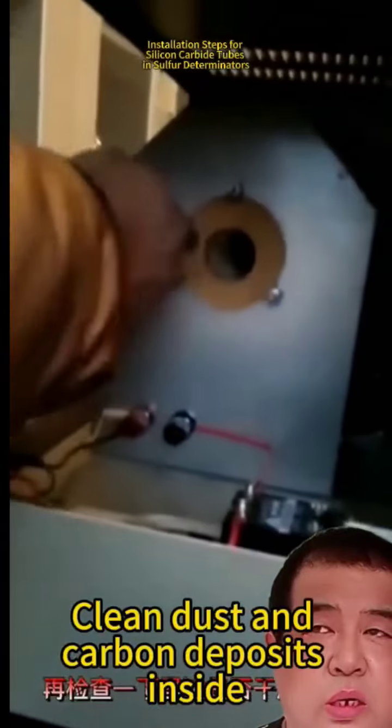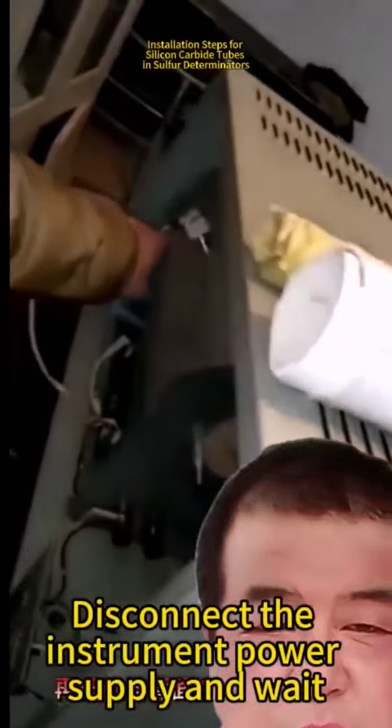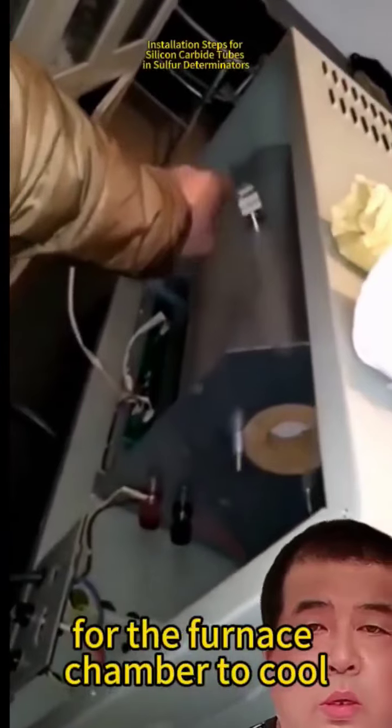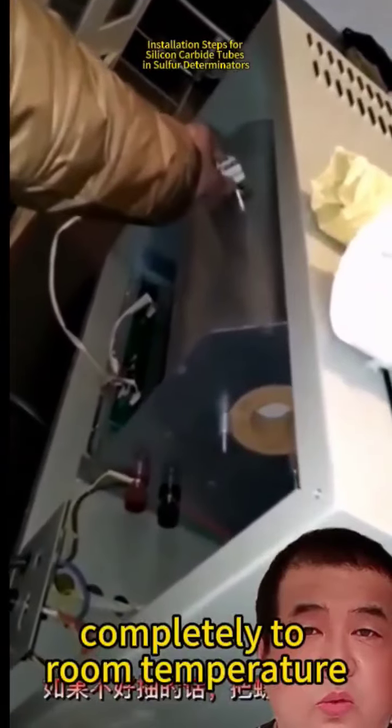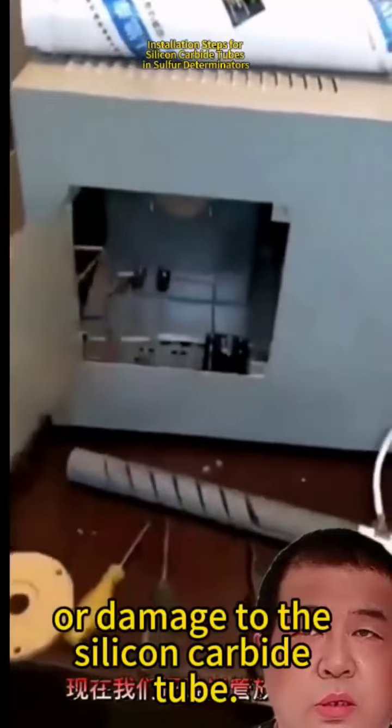Clean dust and carbon deposits inside the instrument furnace chamber. Disconnect the instrument power supply and wait for the furnace chamber to cool completely to room temperature, avoiding high temperature scalding or damage to the silicon carbide tube.